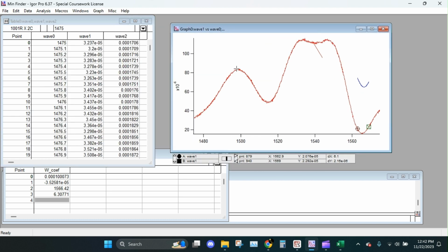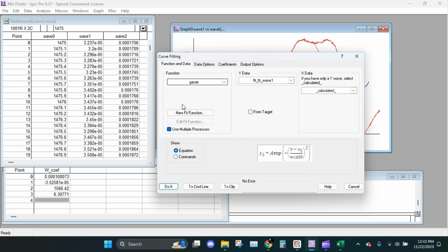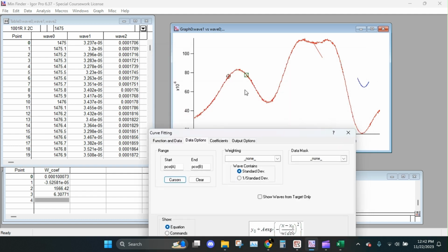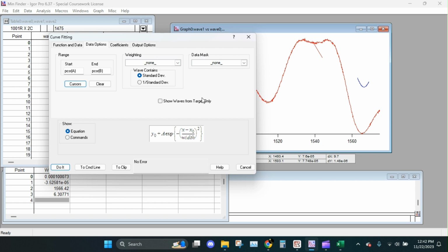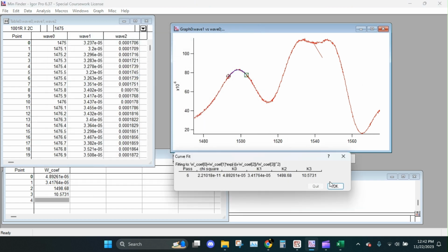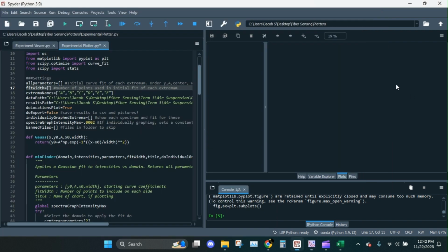Okay, so we could definitely work with this peak right here, this peak right here, and this peak right here. I don't know about these guys. I mean, we'll try. First, I'm going to move these markers over to here. Analysis, curve fit, type Gauss, Y data, wave 1, X data, wave 0. Data options, the cursors, right? We're just grabbing the Gaussian looking bit. Let's see. That should do it. Oh, we can see the blue line, nice fit. Okay, and here it returns all the coefficients. So I like to pull them up side by side.